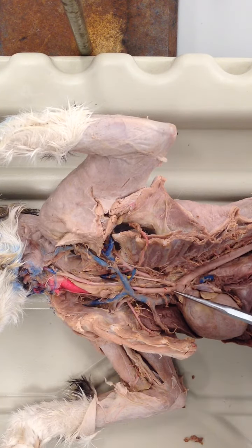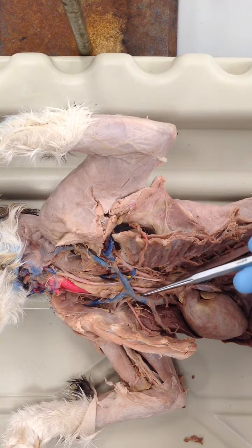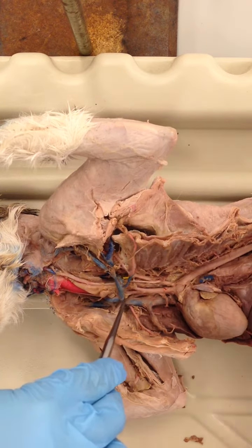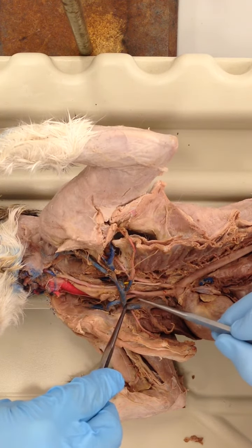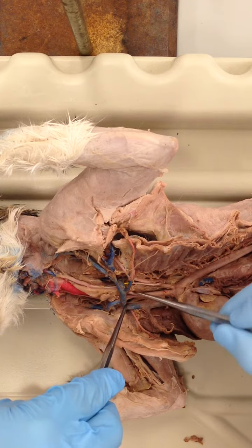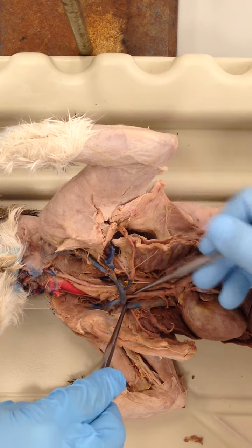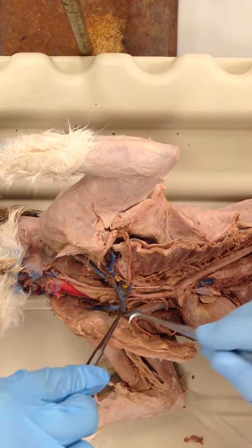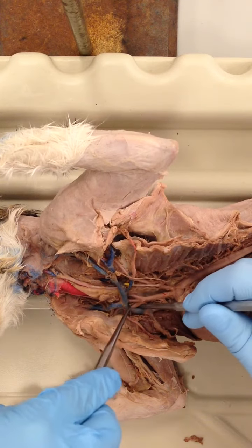If we follow the brachiocephalic artery up, we will notice some other branches. I am going to have our assistant move the vein here, the superior vena cava, away so we can follow these branch points. This brachiocephalic artery then branches into the two common carotid arteries, a left common carotid and a right common carotid artery. Notice that it also branches into the right subclavian. It's kind of difficult to see under there, but here we go. Here we have our right subclavian artery.